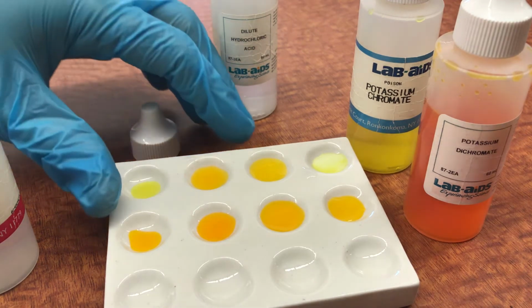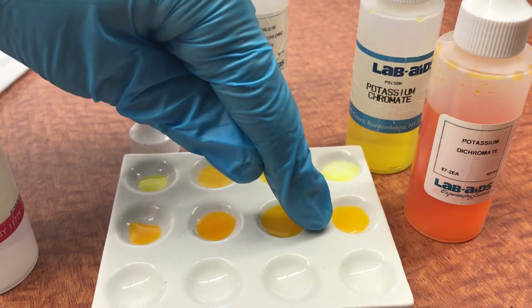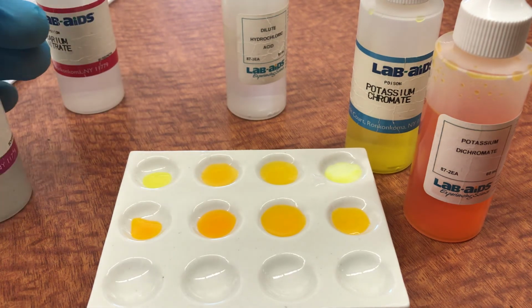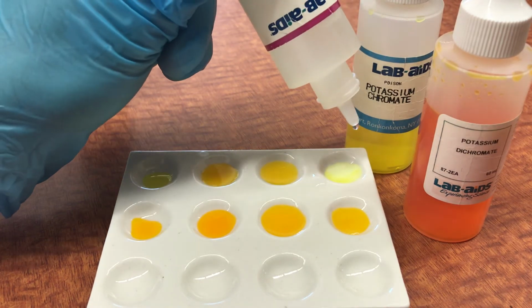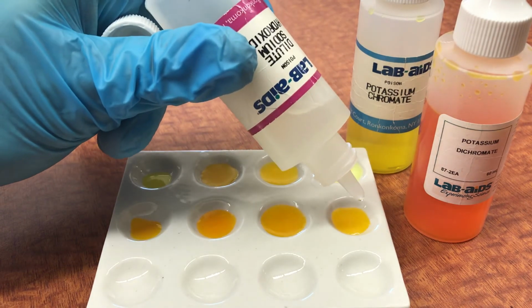So what we really want to notice here is that barium chromate is not very soluble at all. It turns into a solid right away, but the dichromate is soluble. So I want to try one thing. What about when we added, let's see, I think we added the HCl, correct? No, we added the hydroxide. Let's add a drop of hydroxide and see what happens. Nothing too exciting. We add a drop of hydroxide in this one.